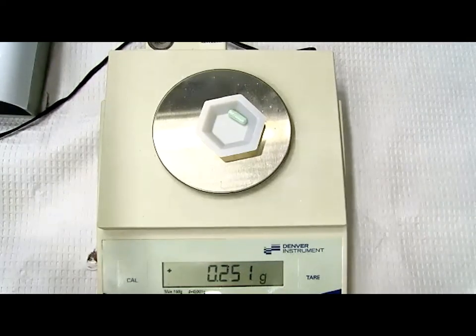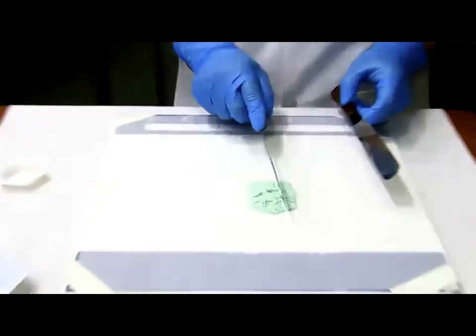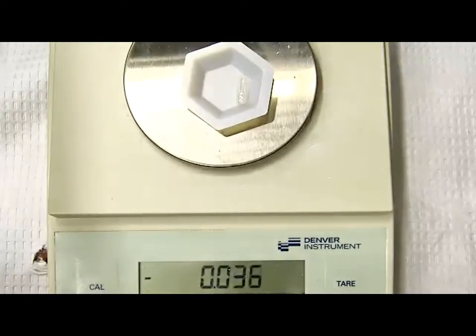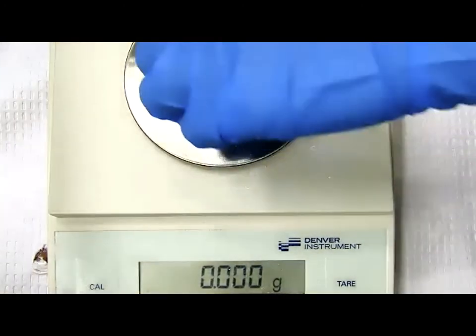Let's move on to the next capsule again. After I finish working with 5 capsules, this is about the powder I have left. At this point, it gets a little bit harder to work with the powder since I don't have a lot. So what should I do? I'm working on my last capsule. By the way, you always have to tare before you move on to the next capsule shell. They should be similar, but they could be different. These 2 are very identical.